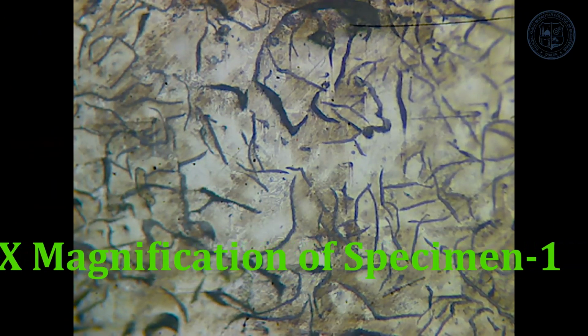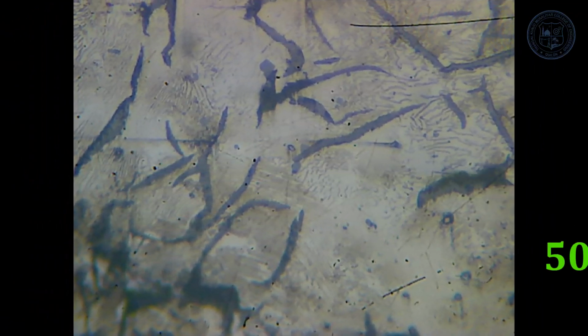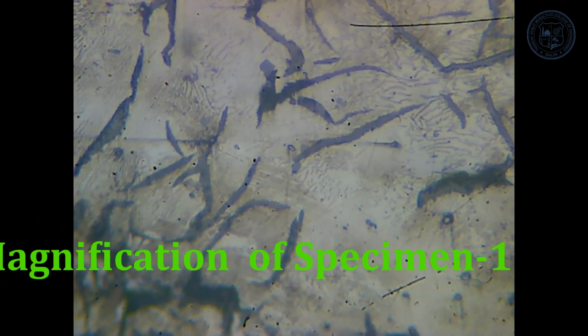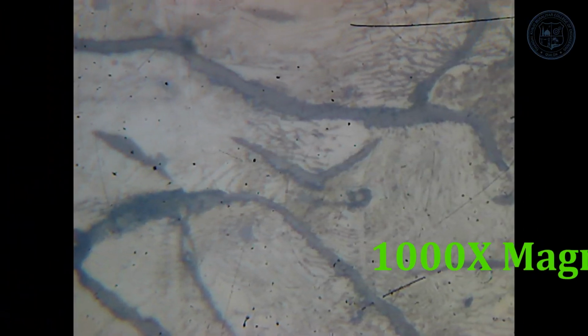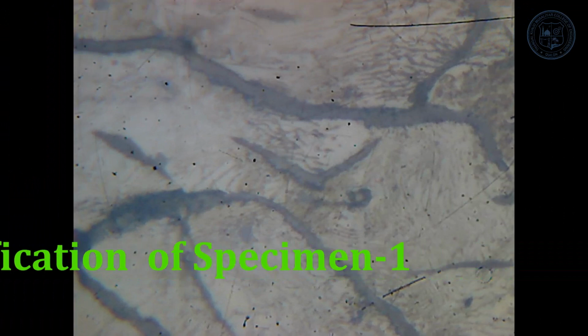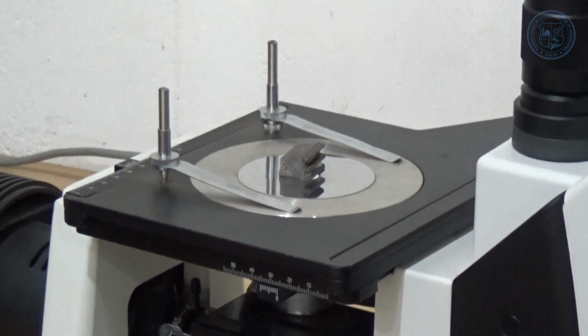By analyzing these images, we can understand that the given specimen is cast iron. As you know, the cast iron microstructure is characterized by the presence of graphite flakes in a ferrite or pearlitic matrix. Similarly, these images can be obtained for the second specimen also.